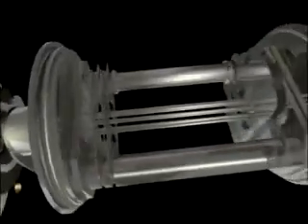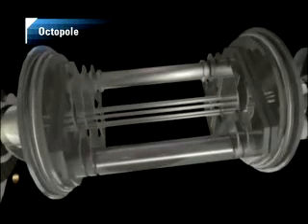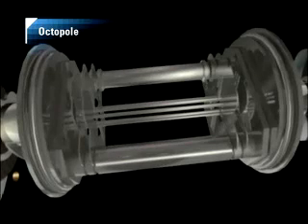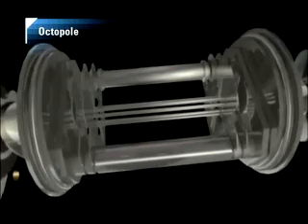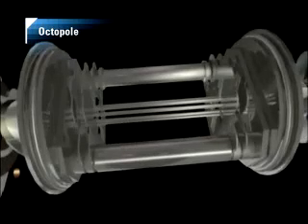Electrostatic lenses focus the ion beam and separate the positive ions from the unwanted neutral species by bending them into the reaction cell, the heart of the octopole reaction system, or ORS. The ORS is unique in using an octopole ion guide in the cell rather than the hexapoles and quadrupoles used in other cell ICP-MS systems. Octopoles are small, reducing the size of the cell and allowing operation at higher pressure relative to other systems.